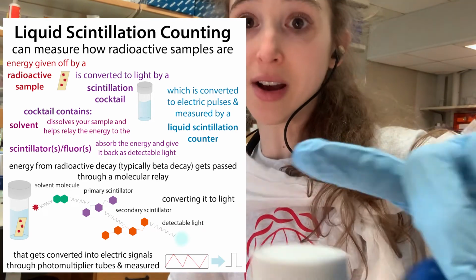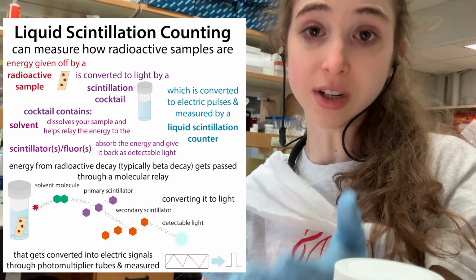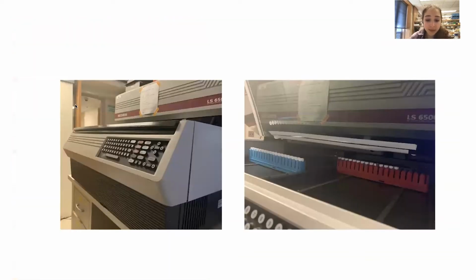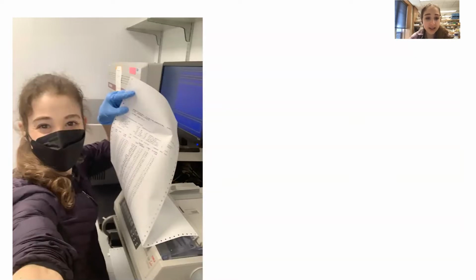So let's talk about how liquid scintillation counting works. I'll get into the details of how it works and the molecular basis and all the stuff about what radioactivity even is and why we're trying to measure it. But first, I just wanted to give you a look at it because I think it's really cool. So this is probably the last selfie I'll be taking with this scintillation counter before I move on to my postdoc at UCSF. And I don't know if I'm going to be using a scintillation counter there, but I've had many a great day with this scintillation counter.